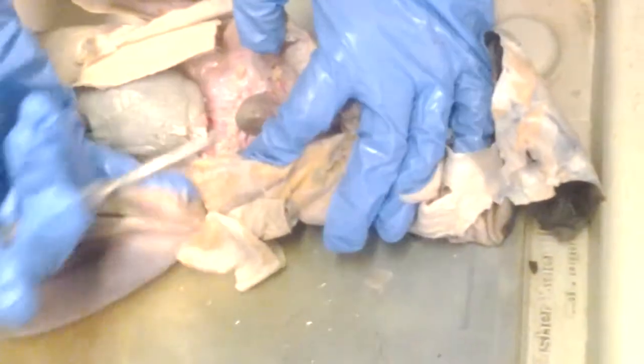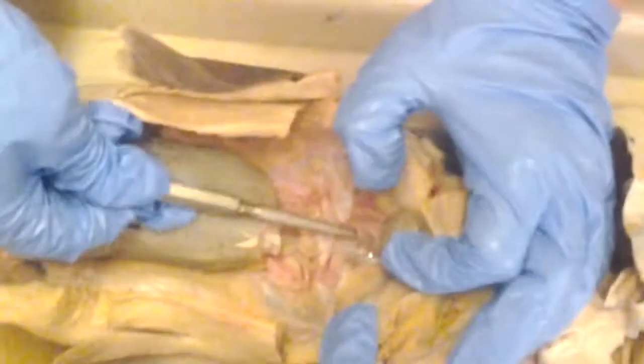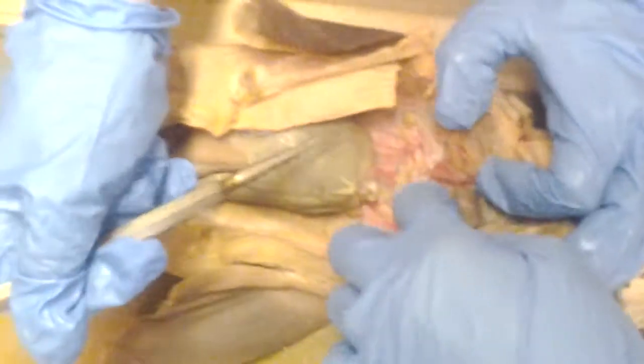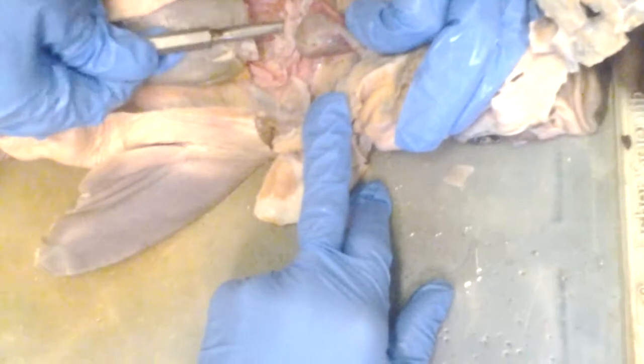Starting from the sinus venosus. The sinus venosus is under the heart. This one is ripped, but it basically goes right into the heart. Sinus venosus, but it's ripped on this specimen. And then that's the two little holes for the liver, right? Yeah, so the hepatic veins, not the hepatic portal veins, just the hepatic veins. Oh, here's one. Those are the two holes.